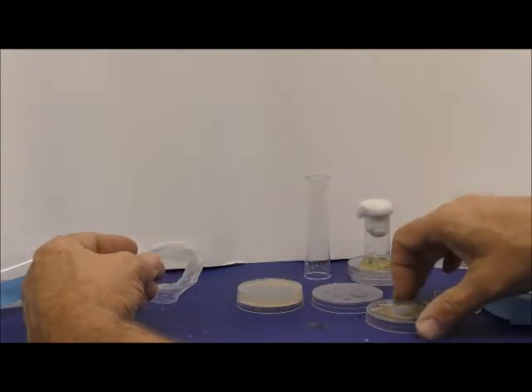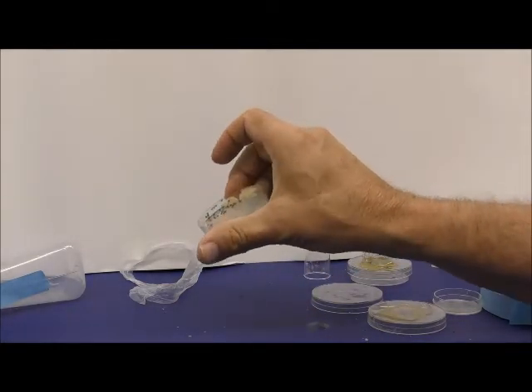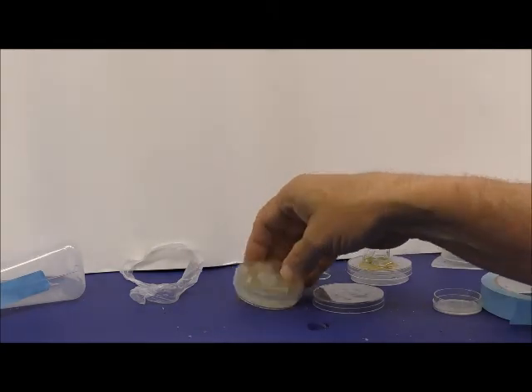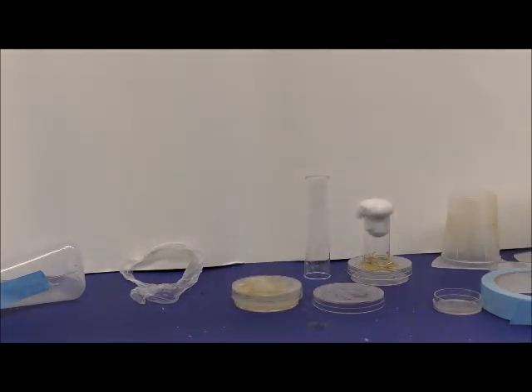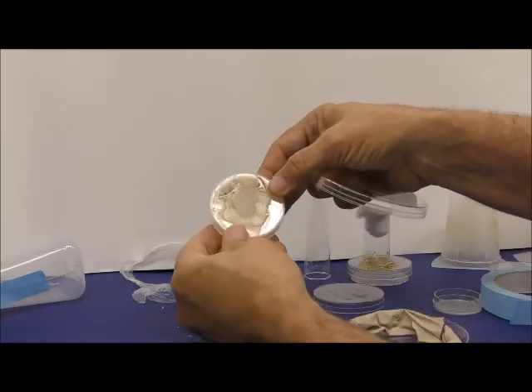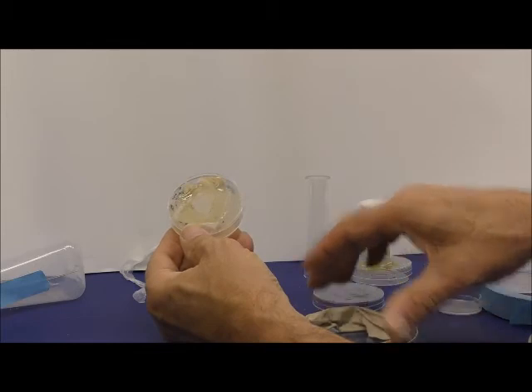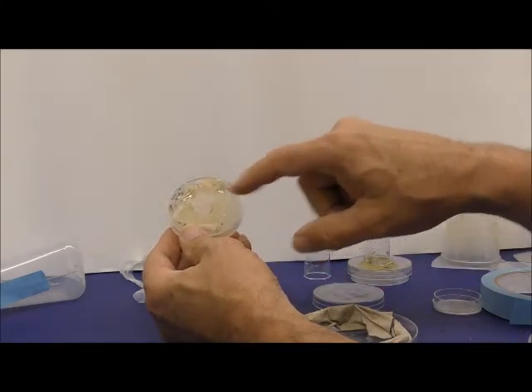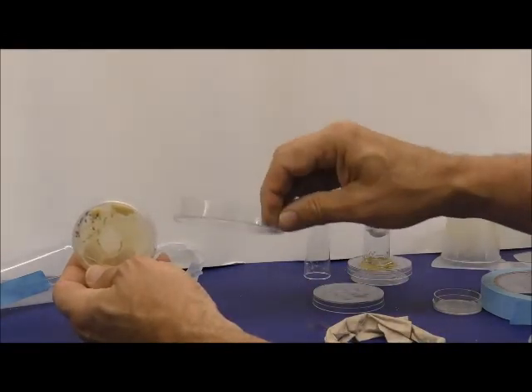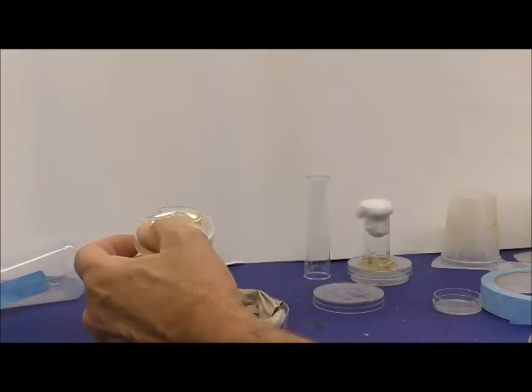Okay, so these are the ways to collect eggs and then store the eggs or the larvae for whatever time you want, and then take them and put them in the different vials of food. If we're going to store the eggs and the larvae for a few days and say we only want third instars, what we tend to do, because the agar and the food will dry out, you can keep adding fluid and water to it, but I tend to take a larger petri dish like this one, these bigger ones, put paper inside, and then add water to this.